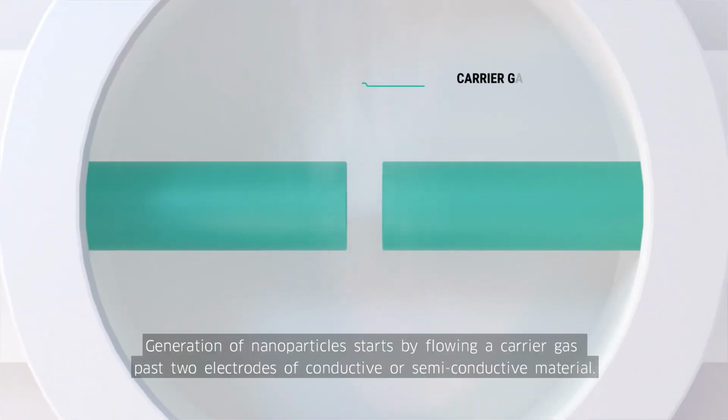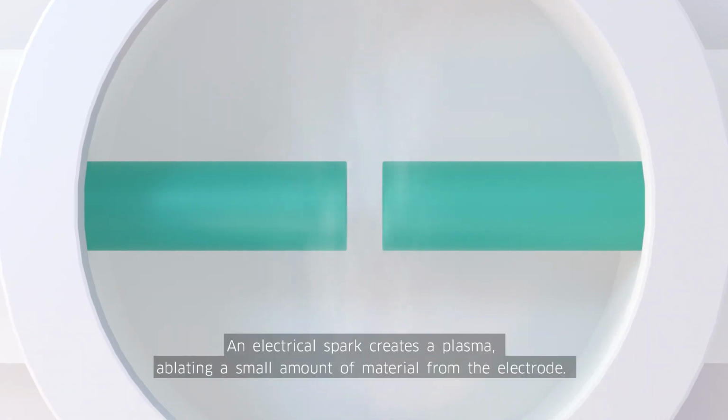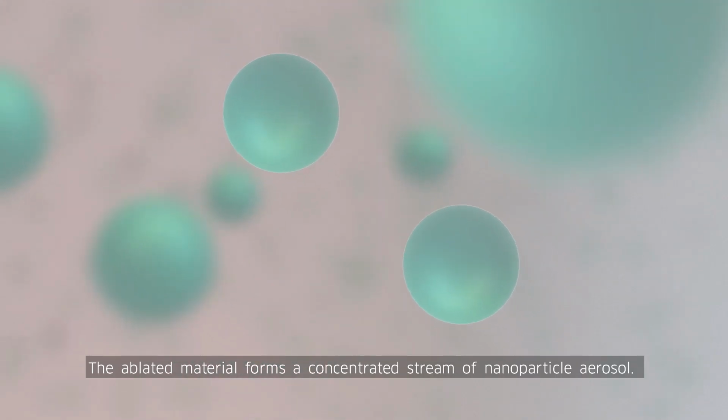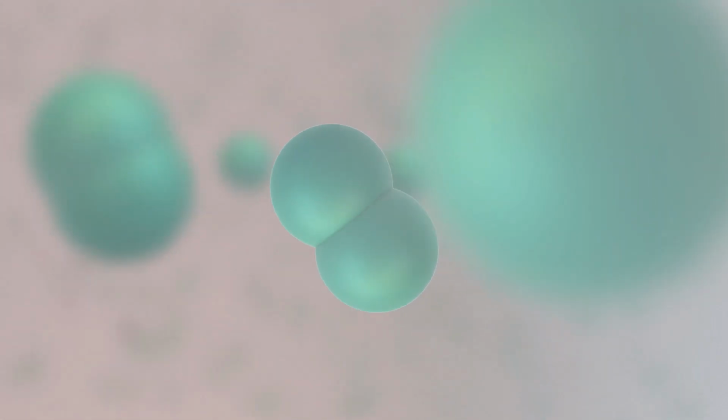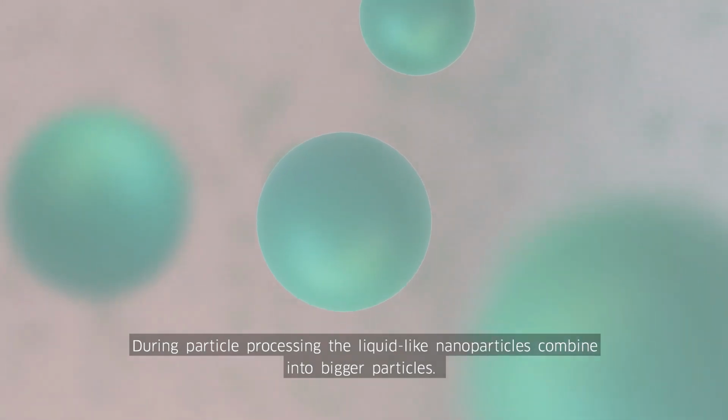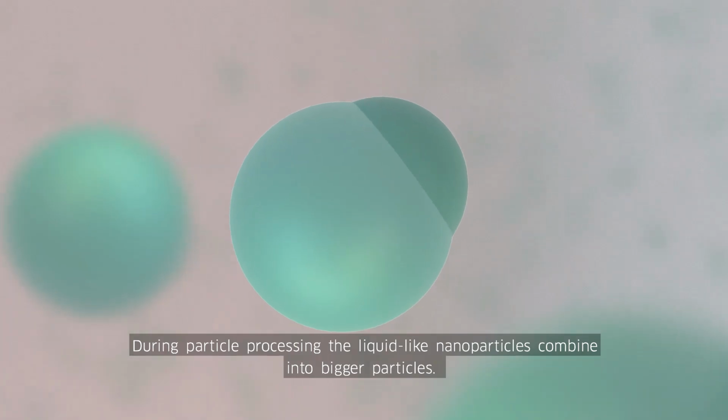Generation of nanoparticles starts by flowing a carrier gas past 2 electrodes of conductive or semiconductive material. An electrical spark creates a plasma, ablating a small amount of material from the electrode. The ablated material forms a concentrated stream of nanoparticle aerosol. During particle processing, the liquid-like nanoparticles combine into bigger particles.